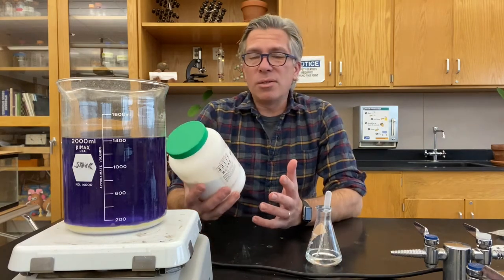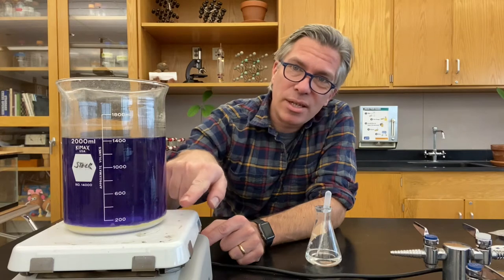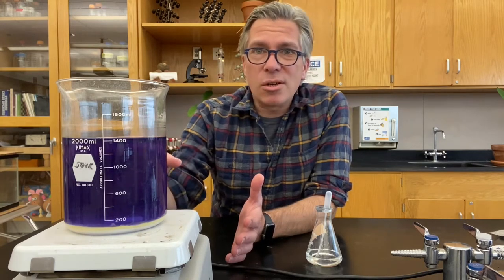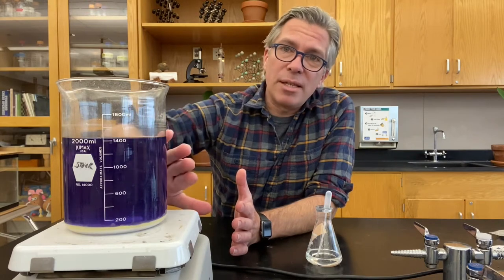Magnesium oxide, like most oxides, is only sparingly soluble. I put a bunch of magnesium oxide in this beaker with water and a little bit of universal indicator — that's what's giving it the purple color. The magnesium oxide is mostly sitting at the bottom, unable to dissolve, but the water is constantly dissolving a small fraction of the ions. This sets up an equilibrium where the concentration of magnesium and oxygen in the water layer is generally constant over time.